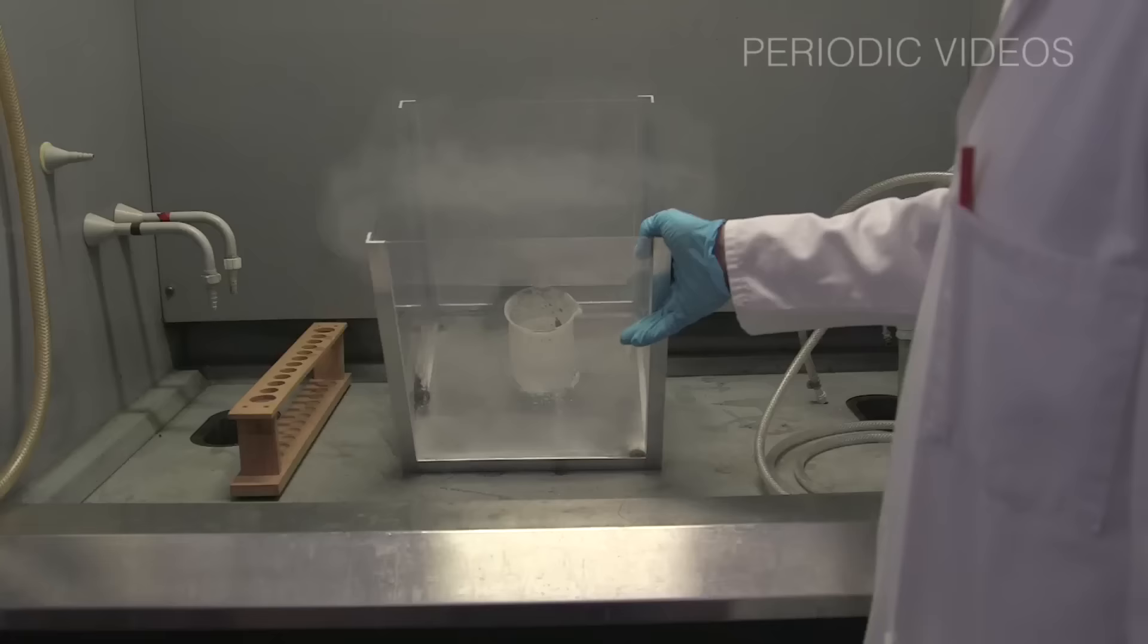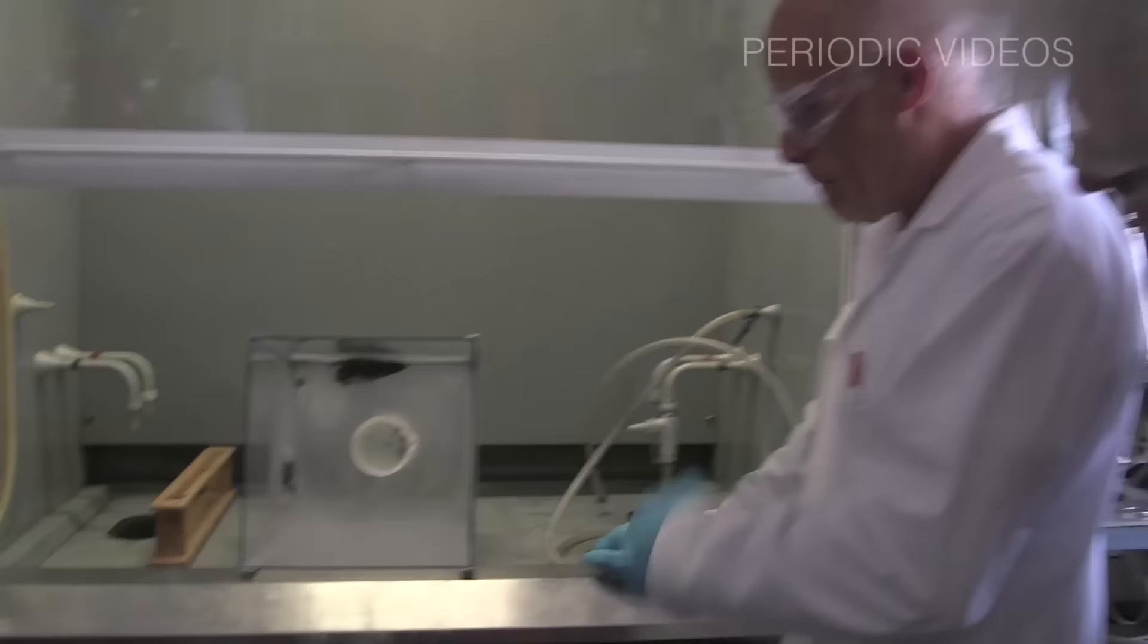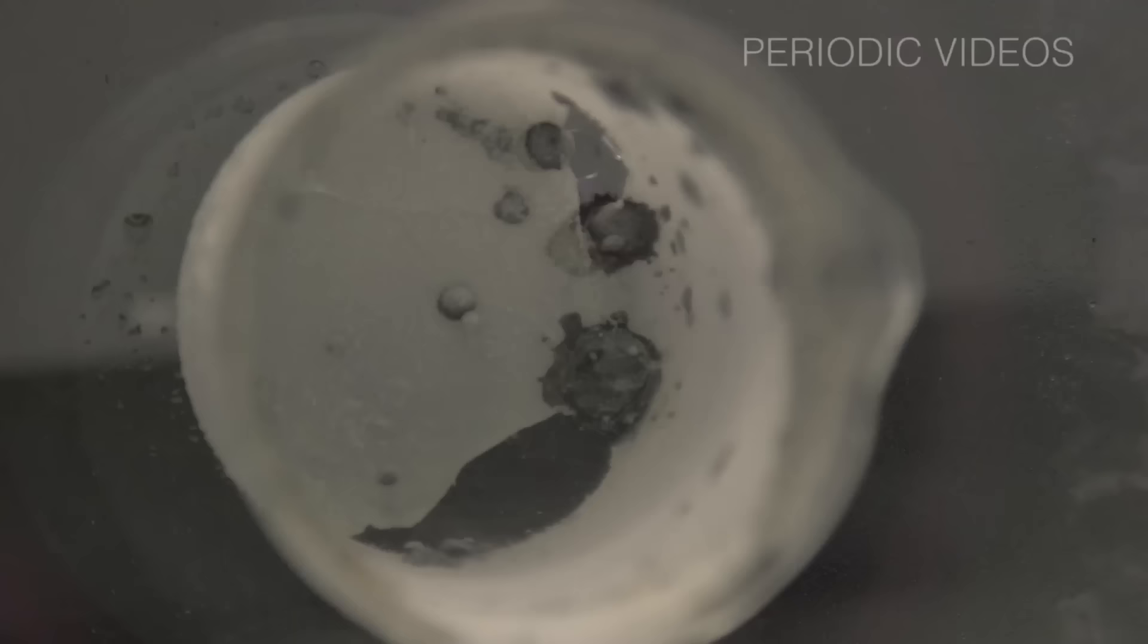But what was particularly surprising to me was that the iron had got so hot that it had actually gone through the glass of the beaker and effectively punched a hole through it.